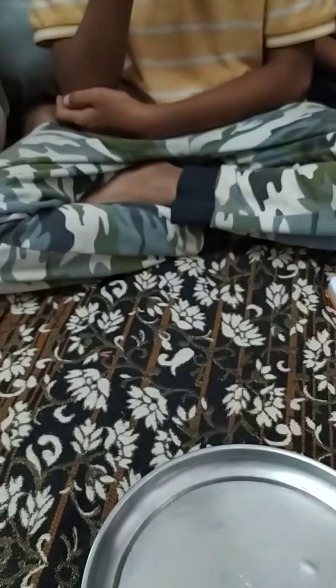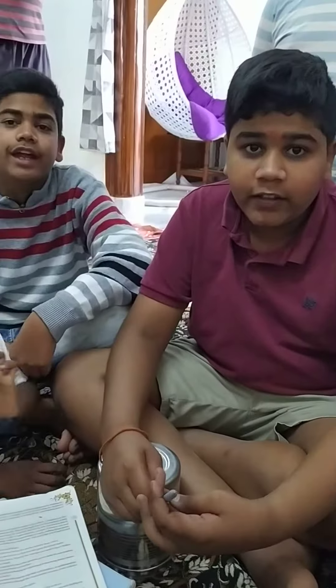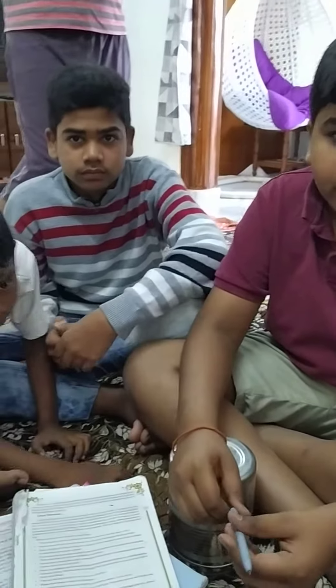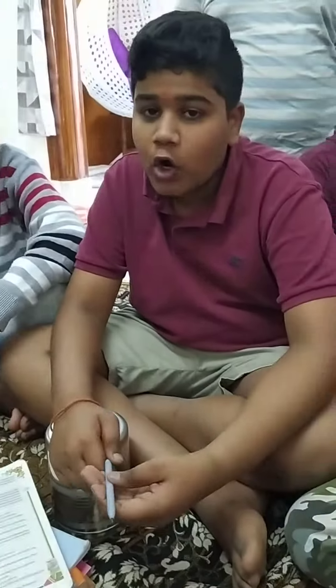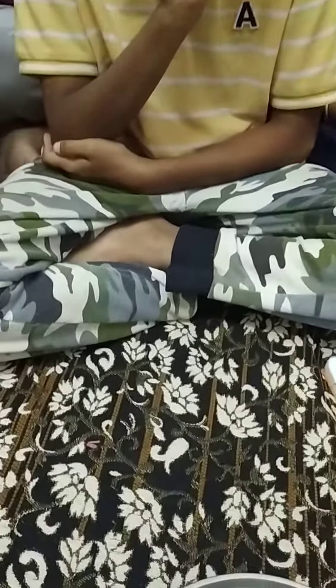For that, what we have? We have methyl orange. Generally, what color is it? Orange color. Normally it is orange color. If it is an acid, what color does it convert to? Red. If it is a base? Yellow. So now, what are we expecting? Yellow — we are expecting yellow.